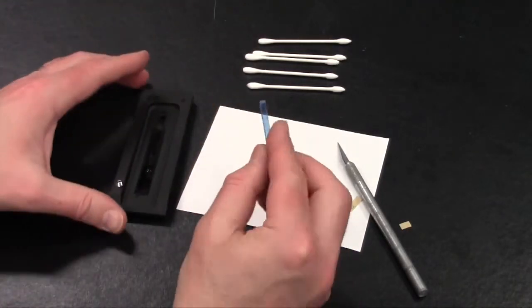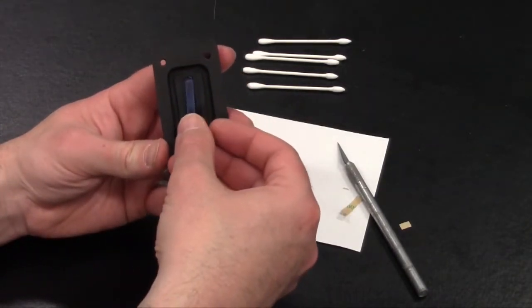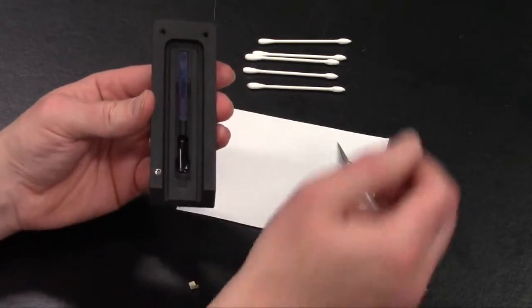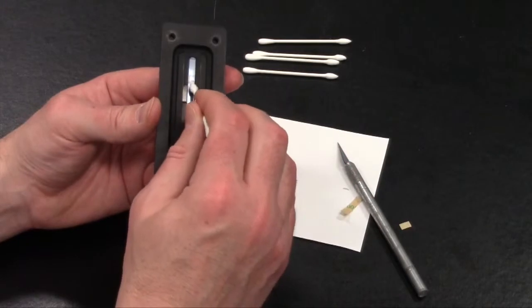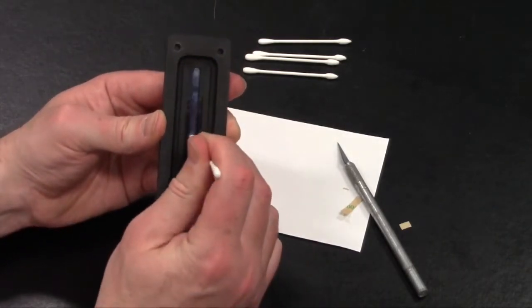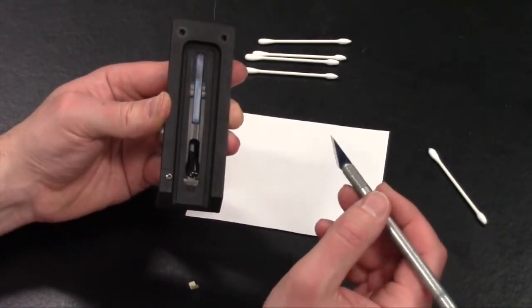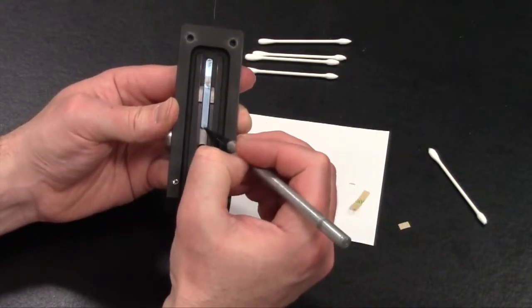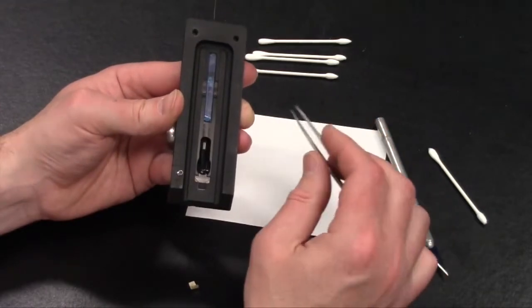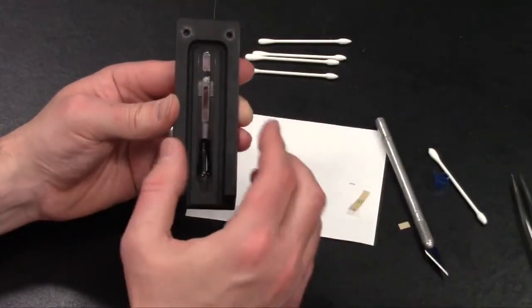So holding the lens with the blue side facing up, you want to put the small end where the window is small into the top of the assembly, and then press down and push the lens into place. What you can do is use the supplied swabs, using the pointed end, and apply some pressure at the very top, the middle, and the bottom of the slide to allow that adhesive to stick. And then very carefully, use that X-Acto knife or sharp tool to carefully lift up from one end of the slide that blue protective cover. You can use a pair of tweezers once you have that lifted up, and then you can use the tweezers to remove the blue adhesive.